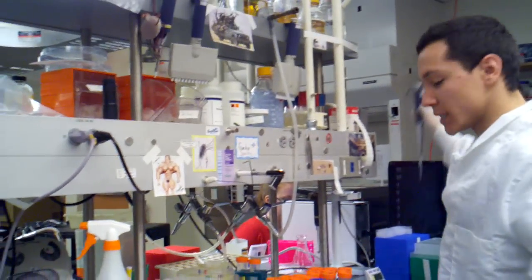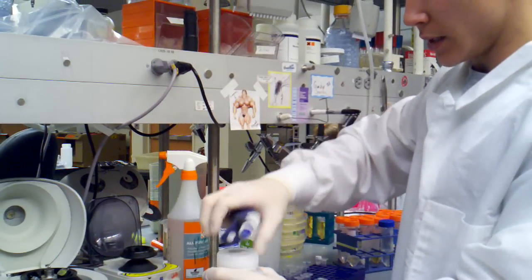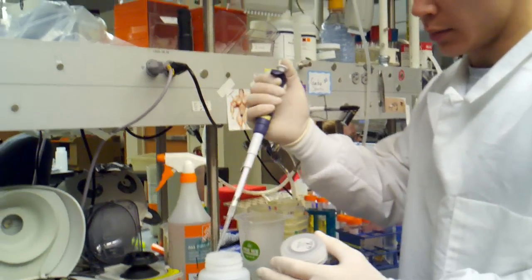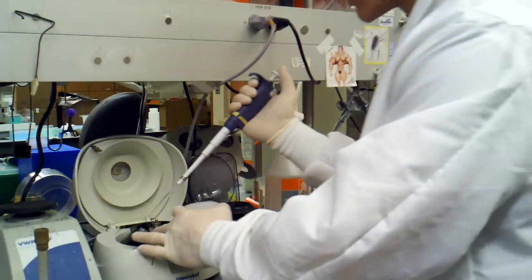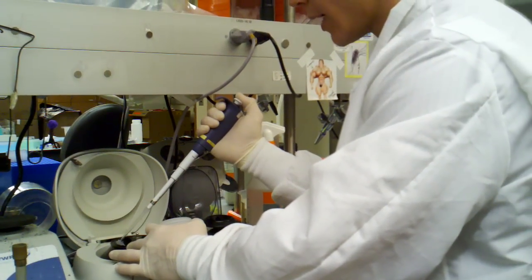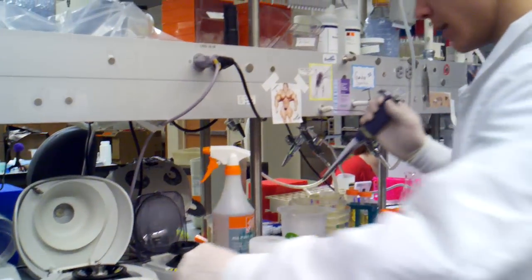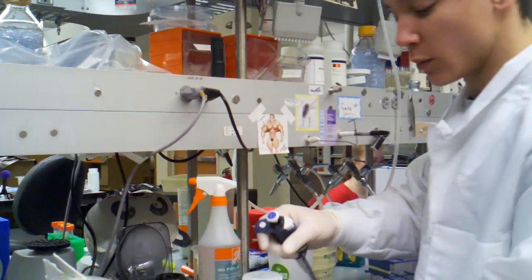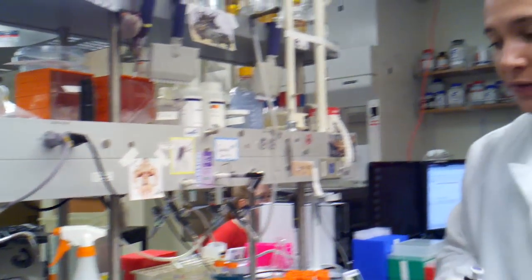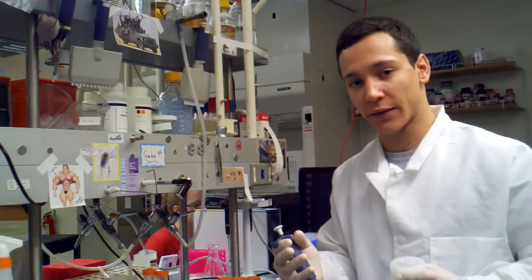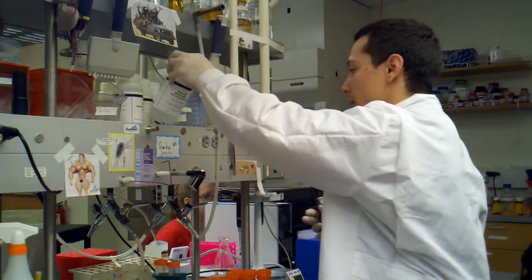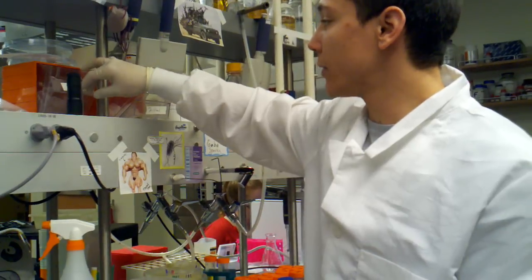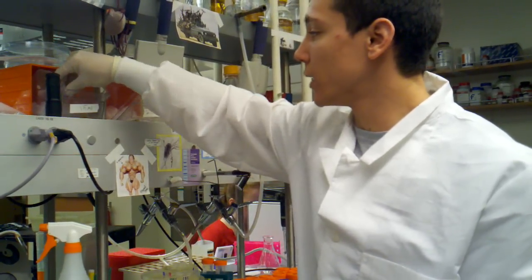It looks like it was just enough, so just discard that flow-through and then add your 750 microliters of PE. Pull that up, double-check your tip, make sure there's no bubbles, make sure everything is good, and fill it up. Then cap it and spin it for 30 seconds again. We're doing 15 seconds for the purposes of the video; 30 seconds is definitely preferable.